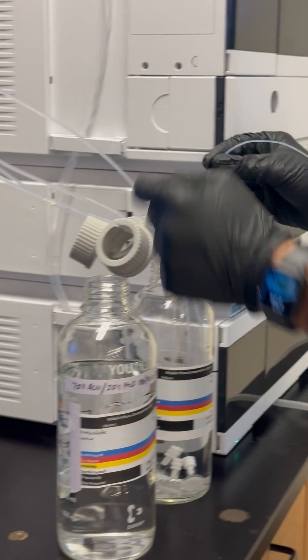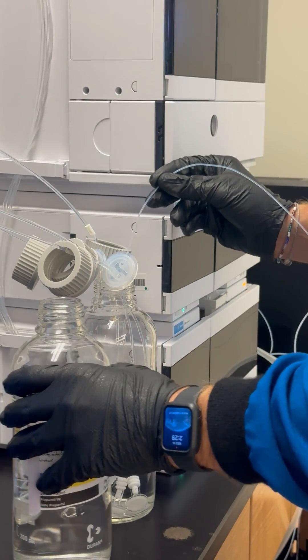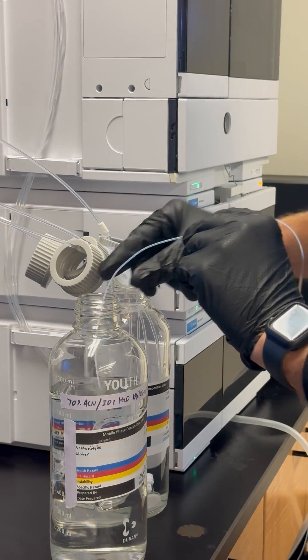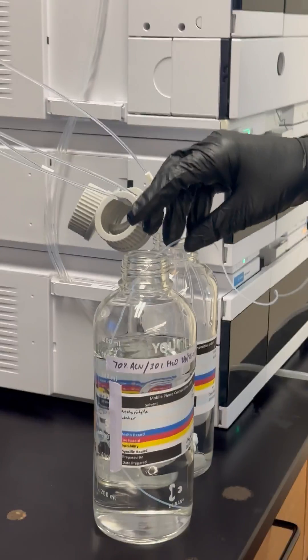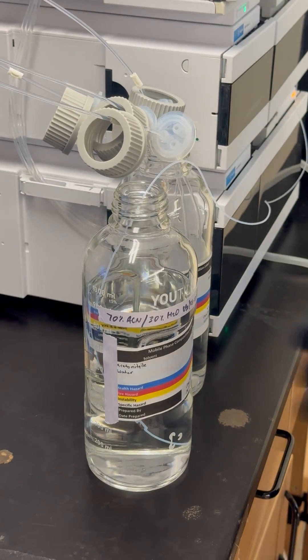This line right here is our needle wash, so this is actually something that's pulled straight from our mobile phase. What that will do is wash our needle in between injections, and we will manually wash before we even start. So make sure this is in.